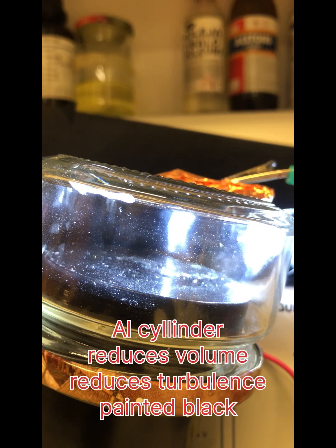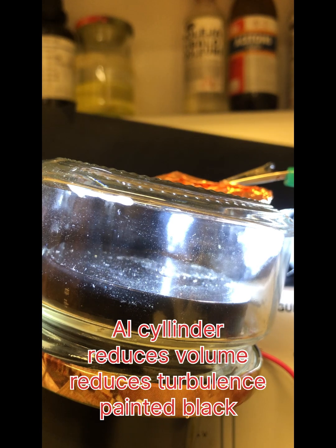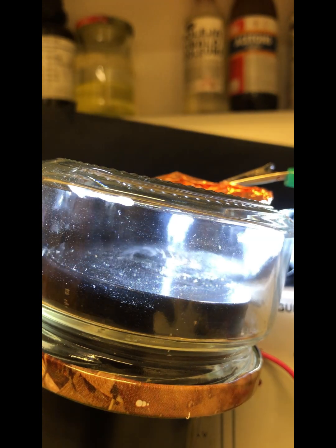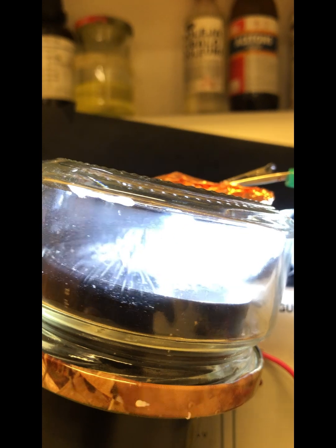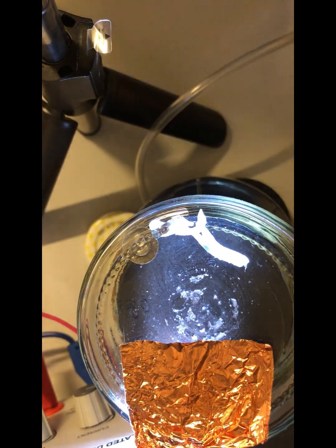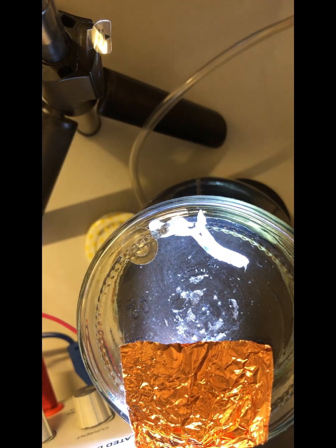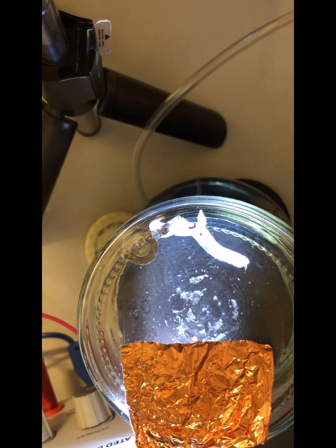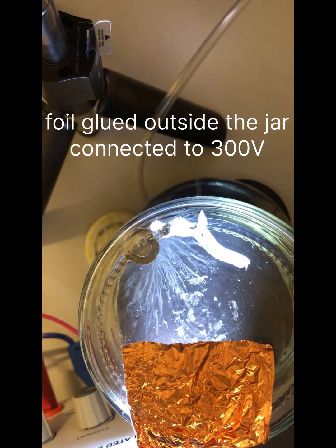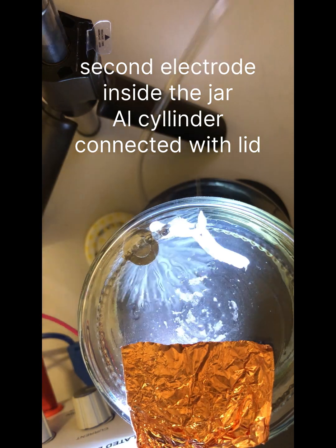Put the metal disc inside the jar. We have tracks, but the path length is too short. Looking from above, looks great. Copper foil, it's an electrode for electrostatic collection. It's outside.